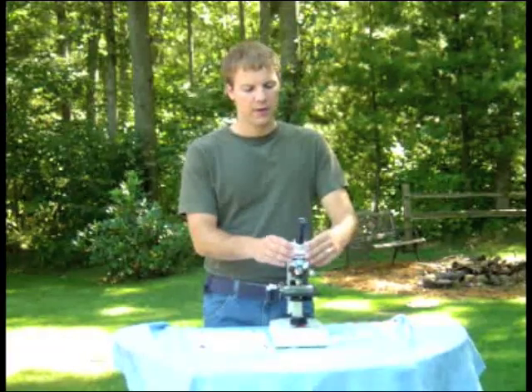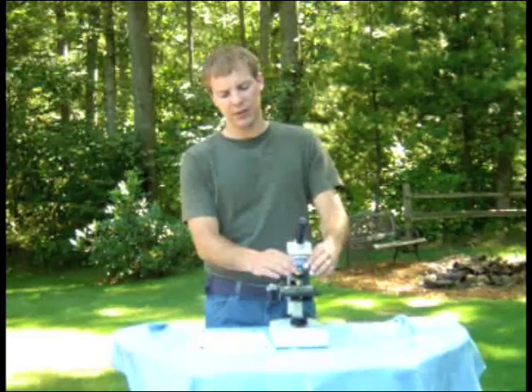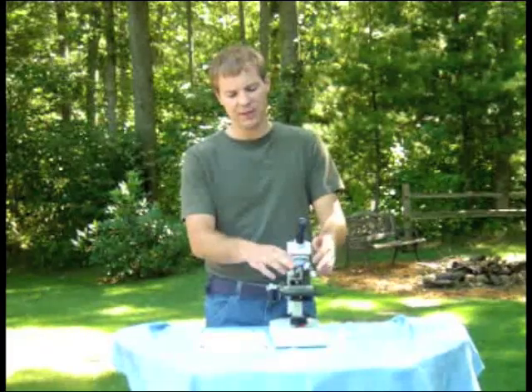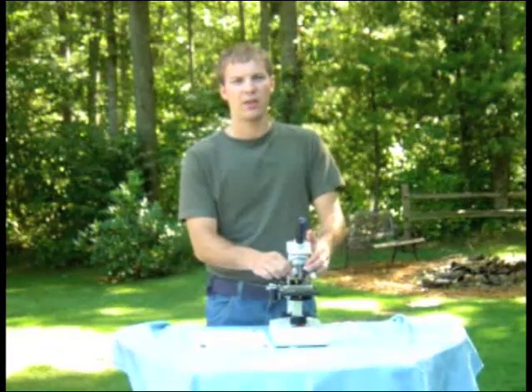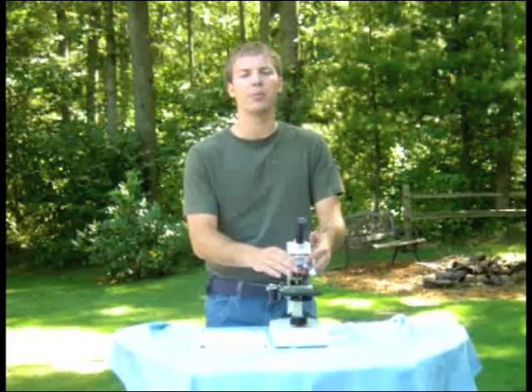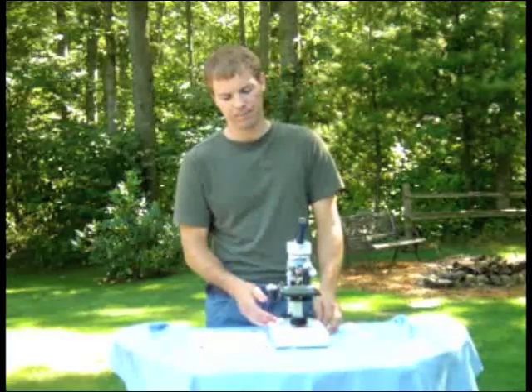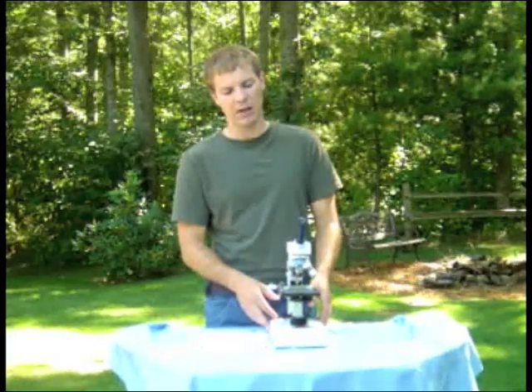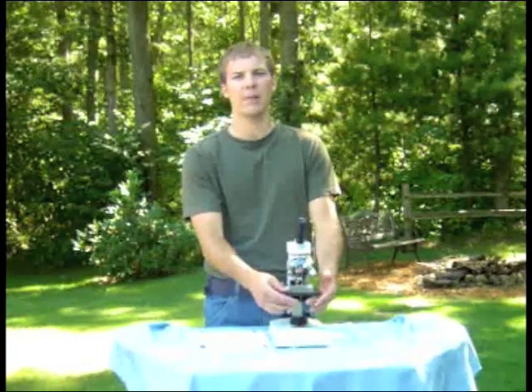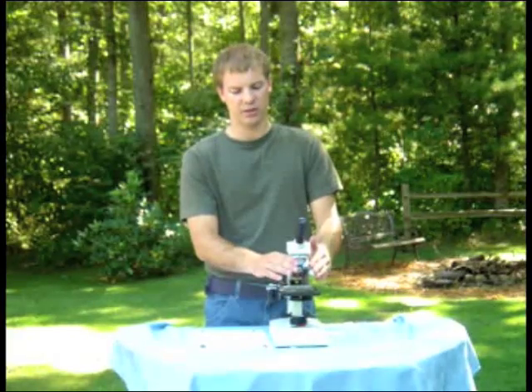If the eyepiece is still black when you look through it, make sure the objective lens is clicked into one of the positions. If it's between positions, you'll see nothing, so make sure you can feel it click into place. Those are three very commonly made mistakes: light on, diaphragm turned to one of the circles, and objective lens clicked into place.